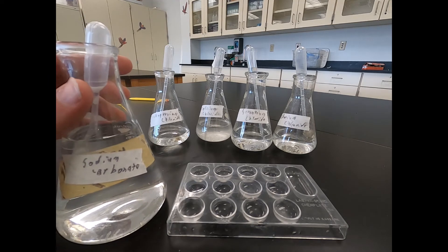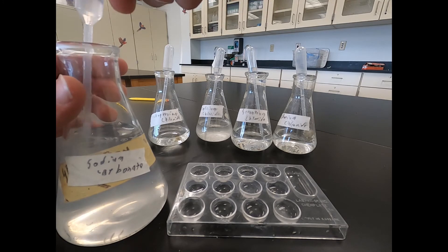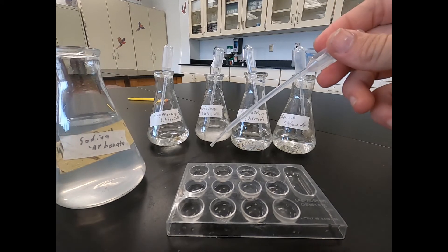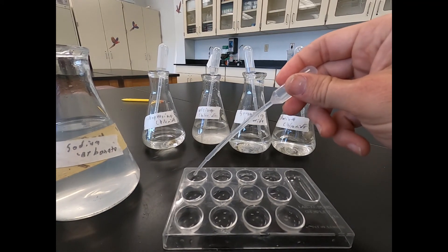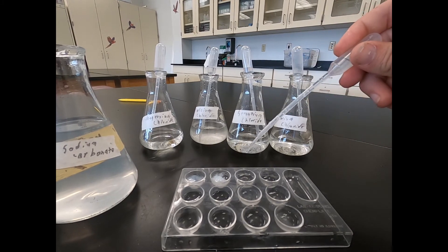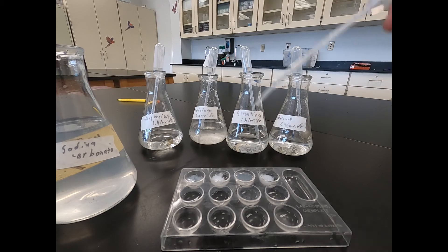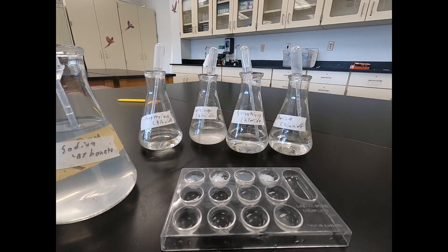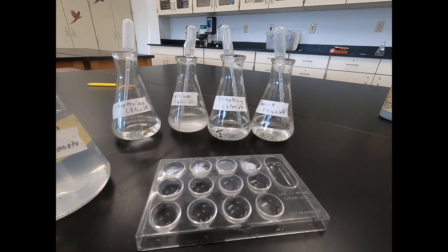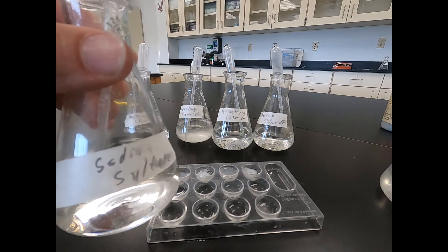So now that we have all our slots filled, we're going to use our testing solutions. Our first one's sodium carbonate. Again, these are colorless solutions, so we're looking for the formation of a precipitate — typically a white precipitate in this case. I'm just going to go all the way across the first row with the sodium carbonate. And we should see that white cloudy precipitate formation. So that was sodium carbonate.